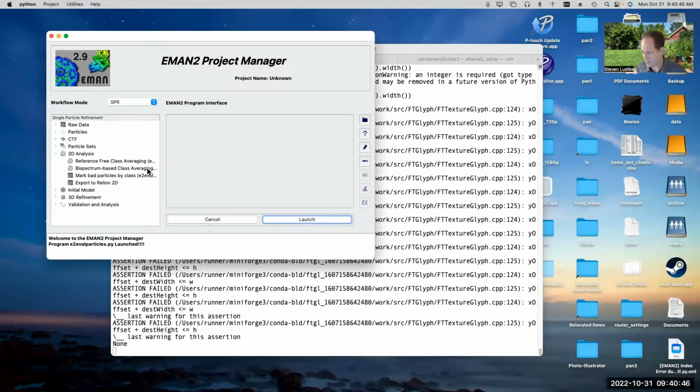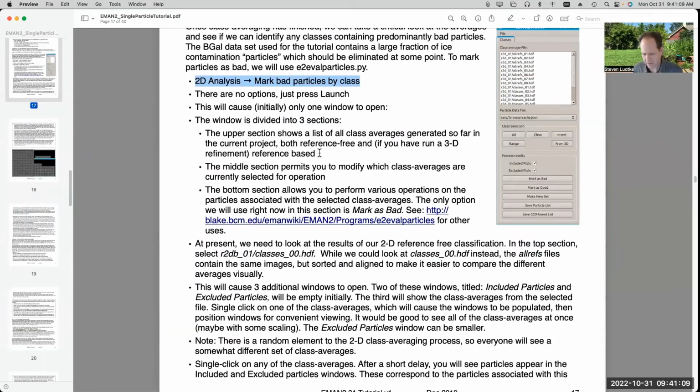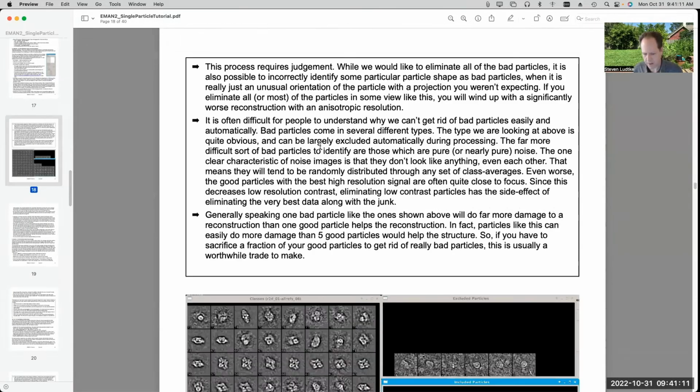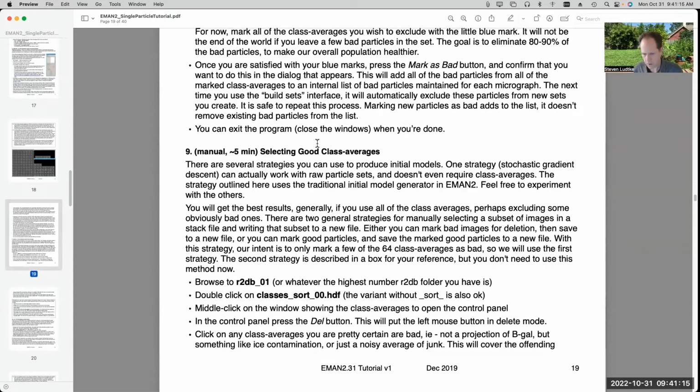Again, that process is optional. You don't need to do it to get good results out of the tutorial. It's potentially useful if you have data sets that have, for some reason, I can't seem to resize my windows. That's weird. Oh, it's the smallest looking. Okay, that's fine. Okay, so once we've moved past this optional marking of bad particles, we move on to generating an initial model.